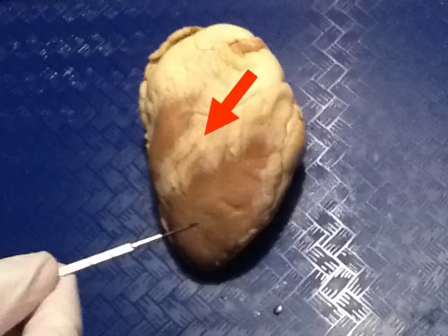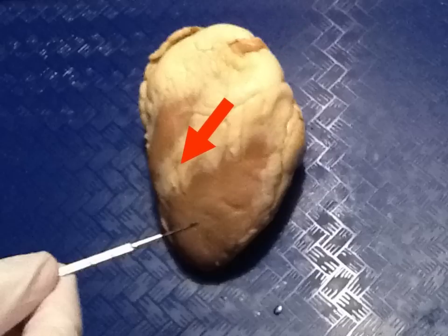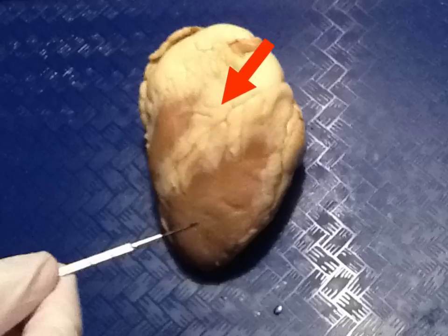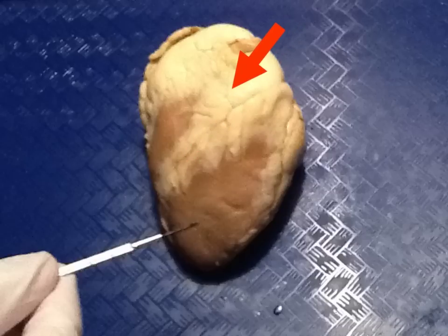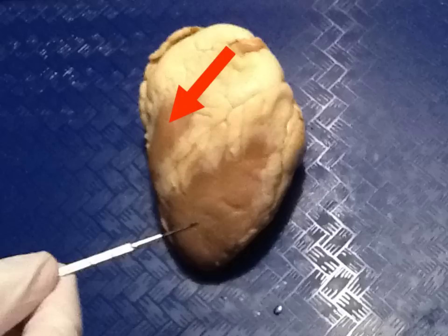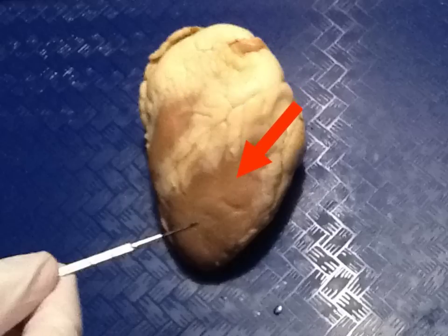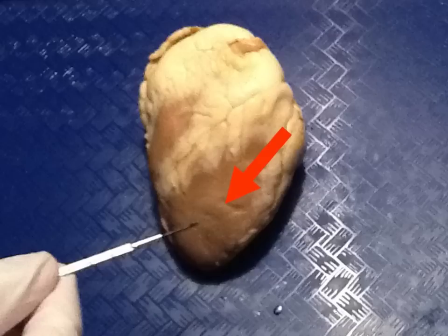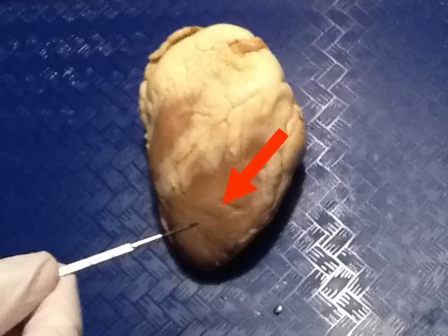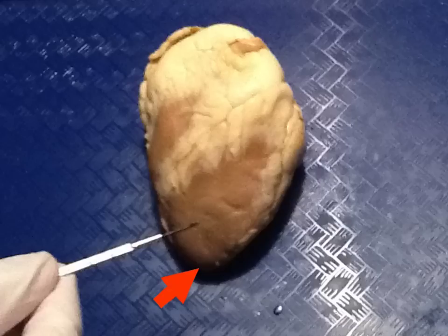This white area of the heart divides the left and right side. Here you see the right side of the heart, and down here you see the left. The pointed bottom portion of the heart is called the apex.